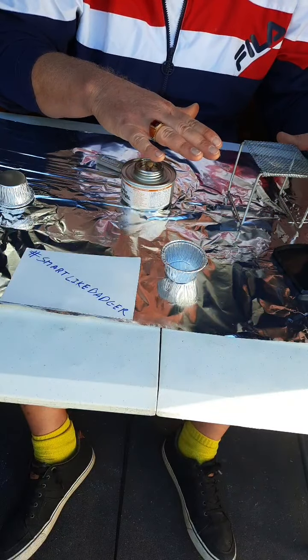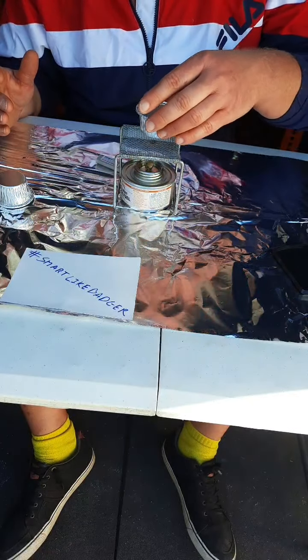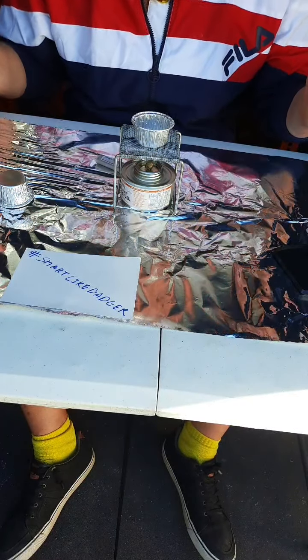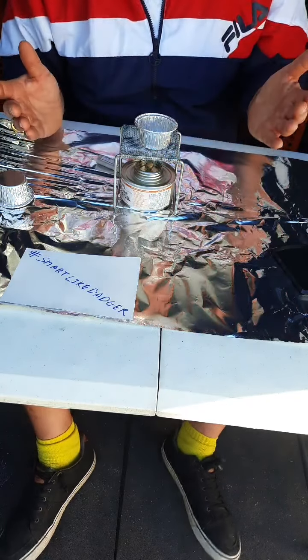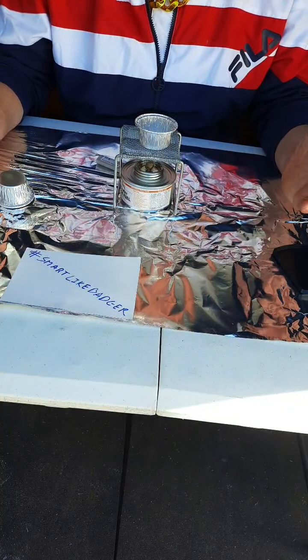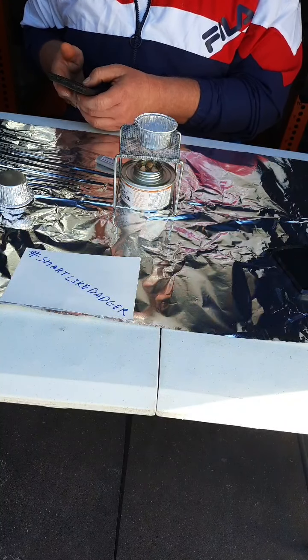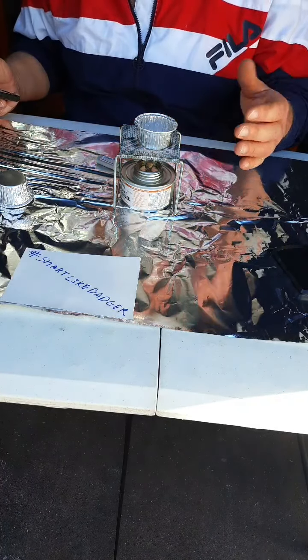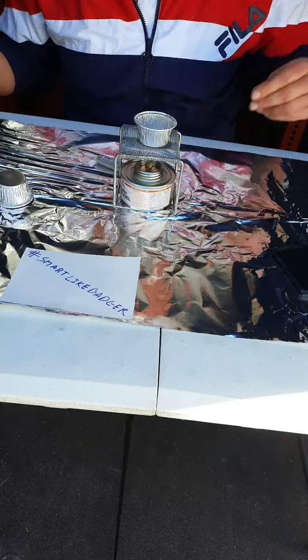That's going. There we go. That's 5. Now that's all we do. We observe what's going on here with the crystals. We start a timer for 5 minutes. Now Boris is doing this outside. Ooh, look at the bubbles. Look at the bubbles. They happen so fast. Ooh, that's super hot.